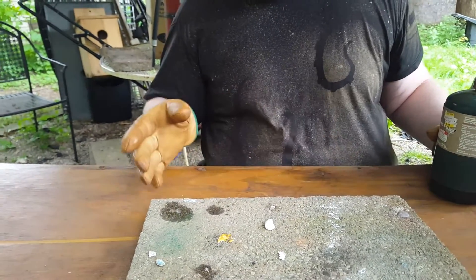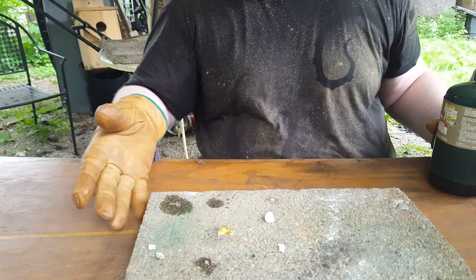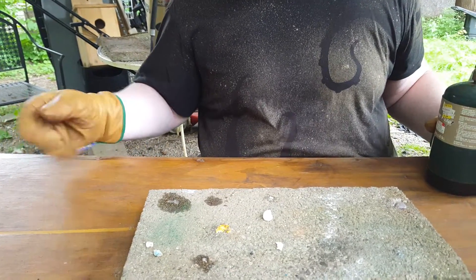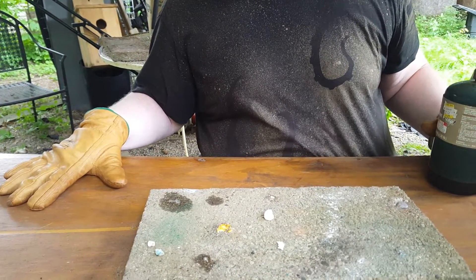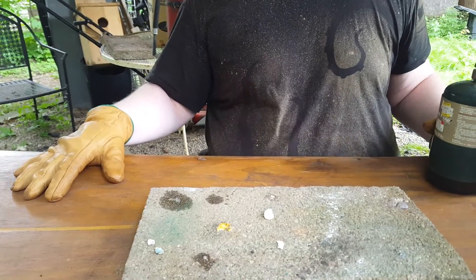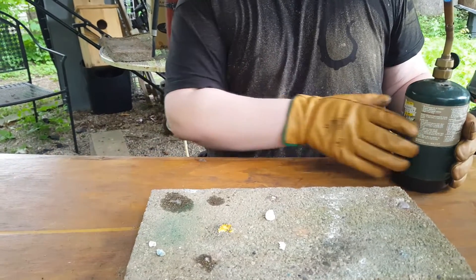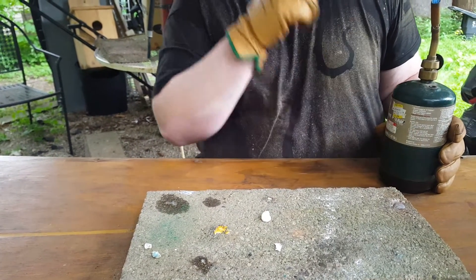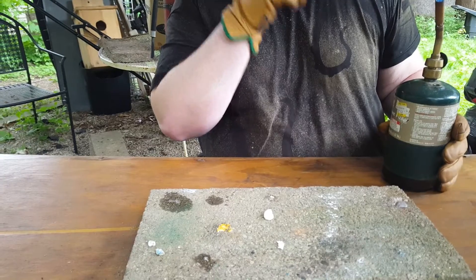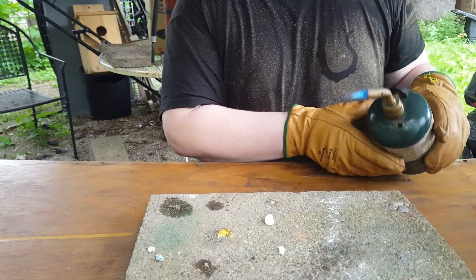I've laid out some salts and you're not sure which ones they are. I'm going to use the flame test on them, and I want you to tell me what you think they are.